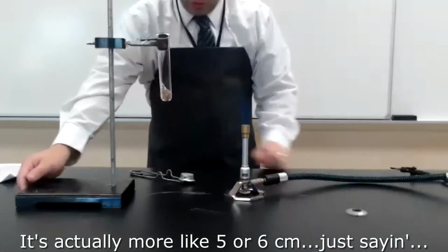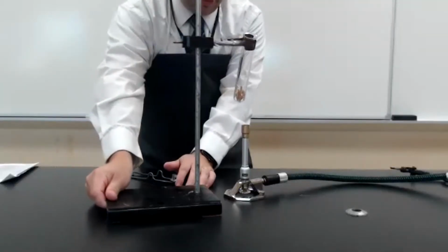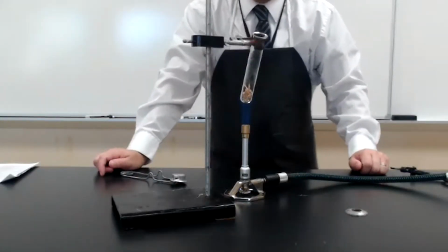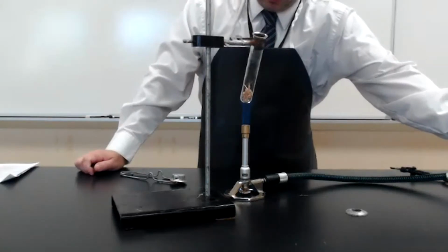At this point, you can slide your test tube containing the wood sample from earlier into the Bunsen burner flame. You can also adjust the flame further at this point. If I wanted to heat it up faster, I could make my flame larger.